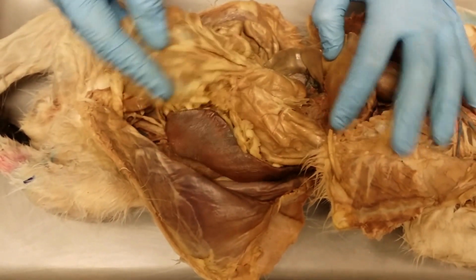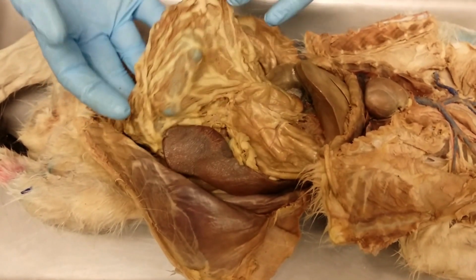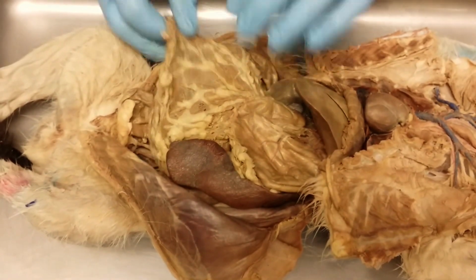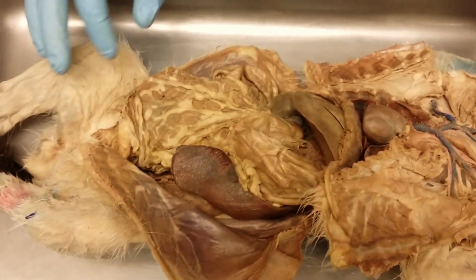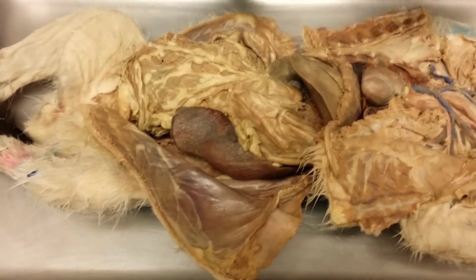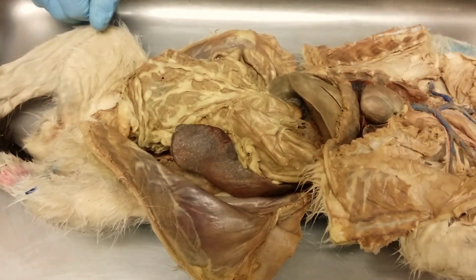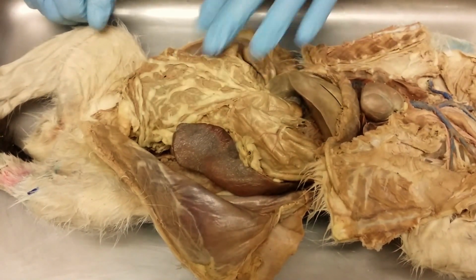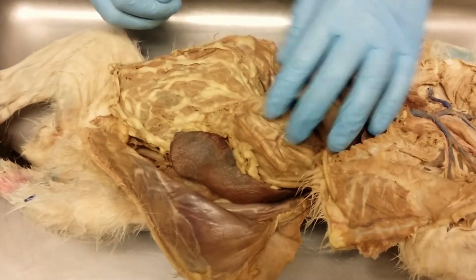Attached to the greater curvature of the stomach, all of this loose connective tissue with fat embedded in it, this is the greater omentum. So greater omentum attached to the greater curvature of the stomach. This is going to lie on top and cover all of the organs of the abdominopelvic cavity. Reason for that is because we don't have a cage like in the thoracic cavity. The thoracic cavity has ribs and hyaline cartilage and a sternum which protects the viscera. The abdominal pelvic cavity doesn't have that. So this greater omentum serves for cushion and protection, okay?